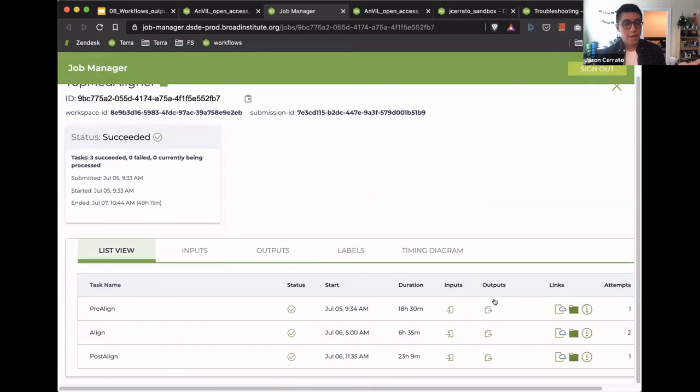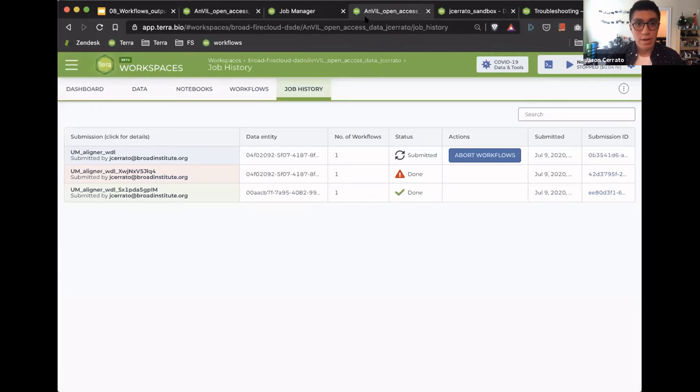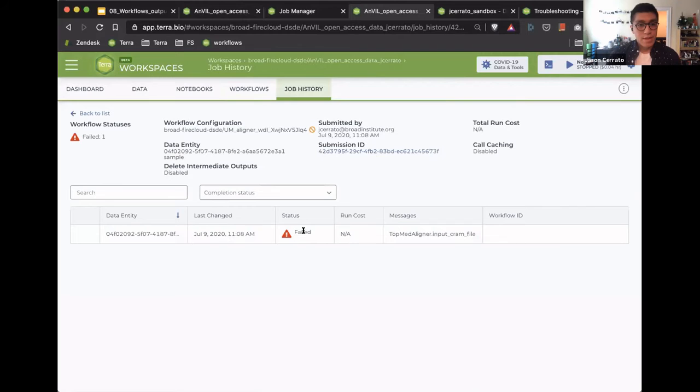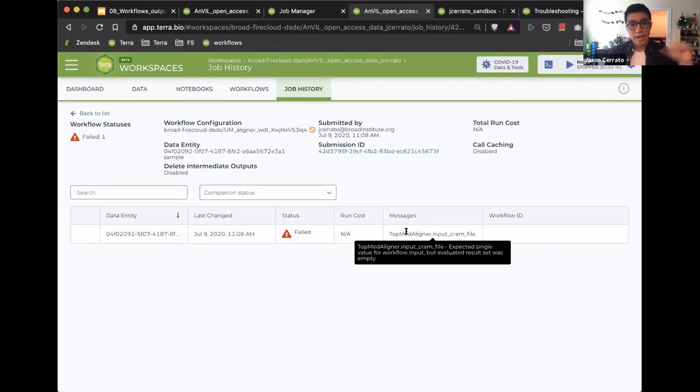And I don't want to go too much over time, but I just want to give everyone a quick glance at some of the ways you can do troubleshooting steps. So if you go, for instance, to one of them that failed, I can see in this job that it failed. And there's a little message here that says expected single value for workflow input, but evaluated result set was empty. And it tells me that there was an issue with the input cram file variable.